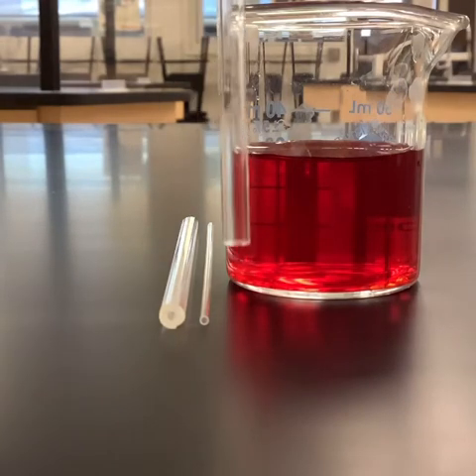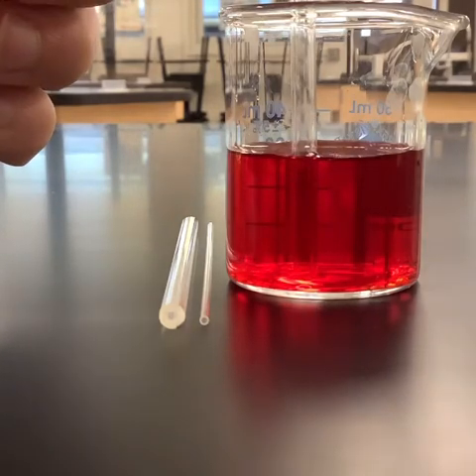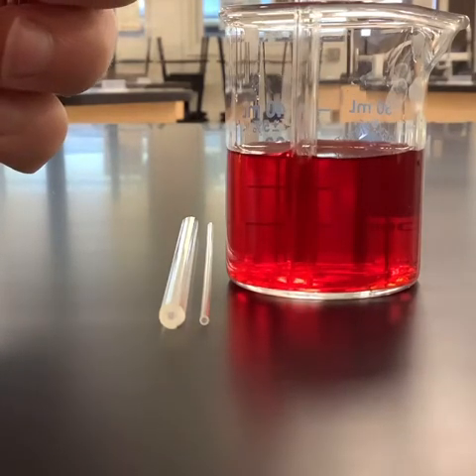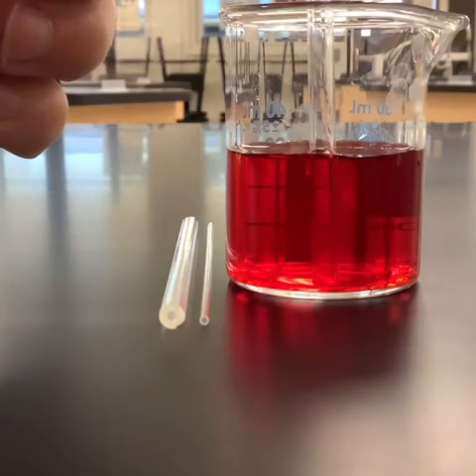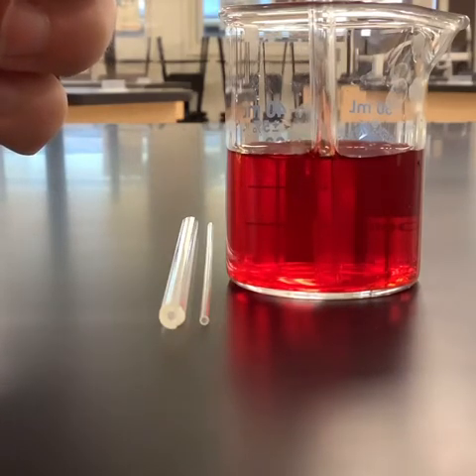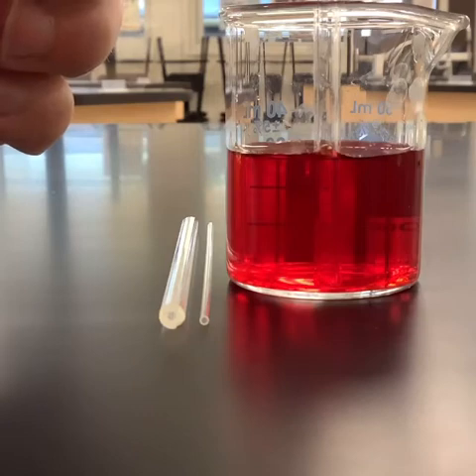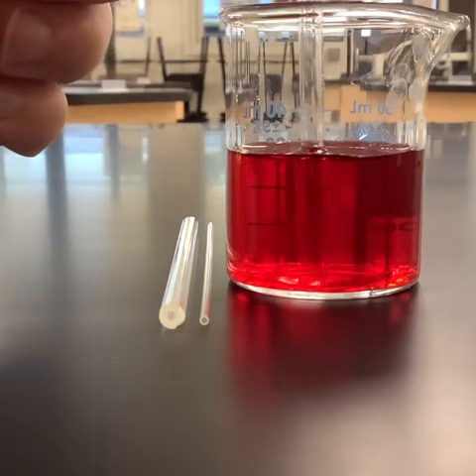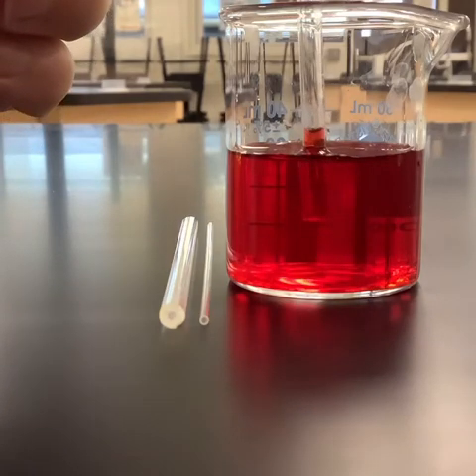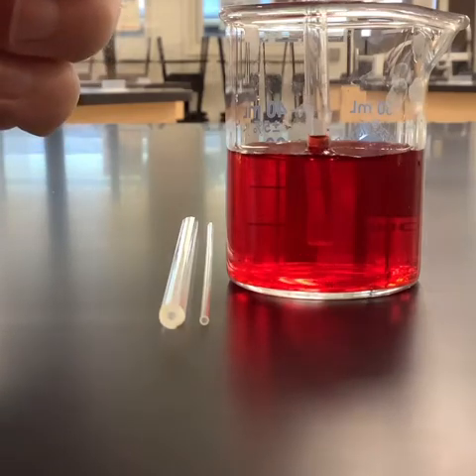So we're going to go ahead and set this inside, and you'll see that when we look at it here, so if I touch it against the side, we start to see some capillary action just between the glass, between the beaker and the tube, right? As you touch it, it's almost like the water's being squished up the side, but we want to actually see what's happening inside. So, right, see when I start to pick it up, we start to see that there's a little bit of capillary action there, right?